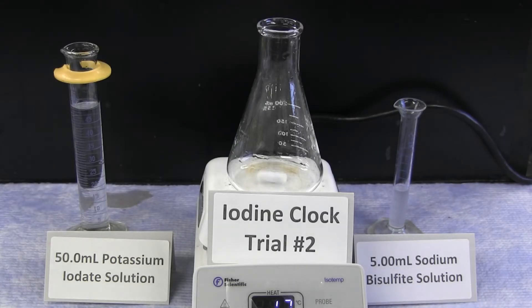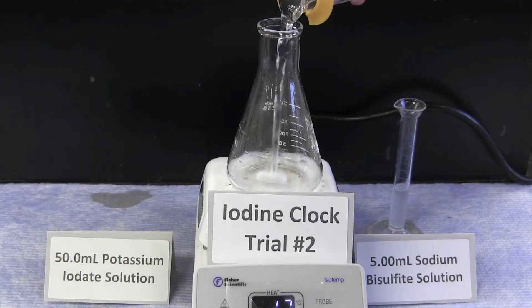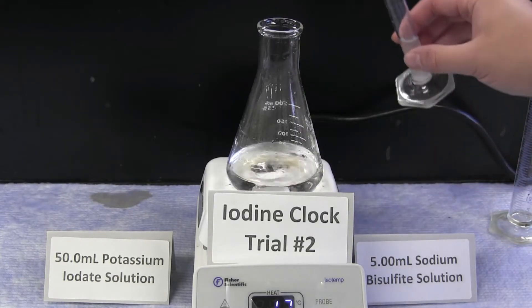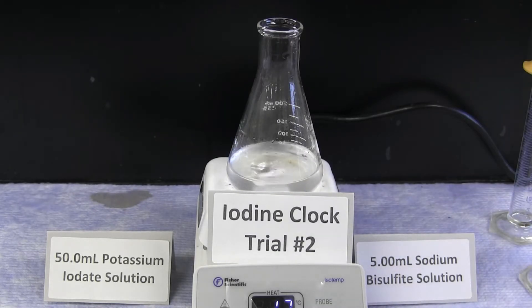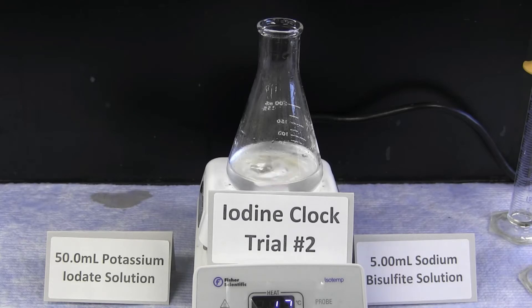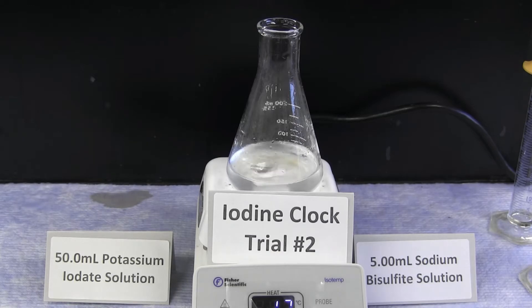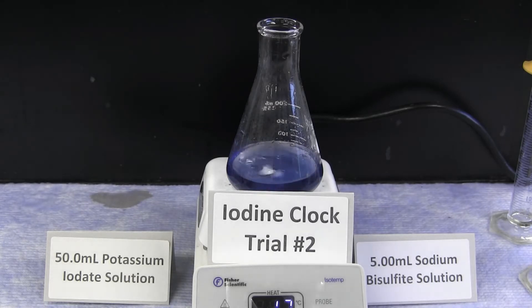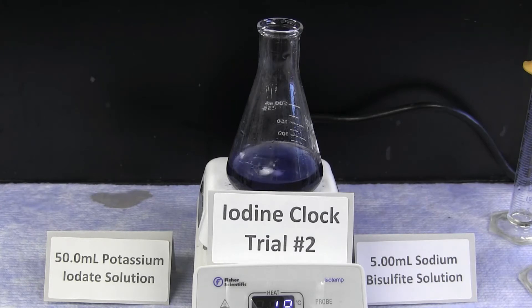A second trial of the same reaction is performed, combining 50 milliliters of potassium iodate and 5 milliliters of sodium bisulfite. By timing the reaction and taking the average of the two trials, you can determine the average reaction time for this reaction based on the concentrations provided. The blue color again represents the formation of iodine upon completion of the reaction.